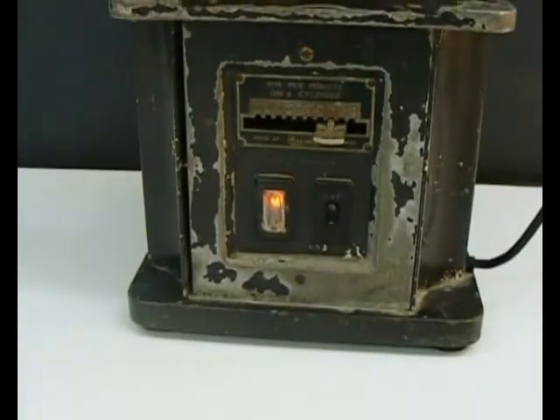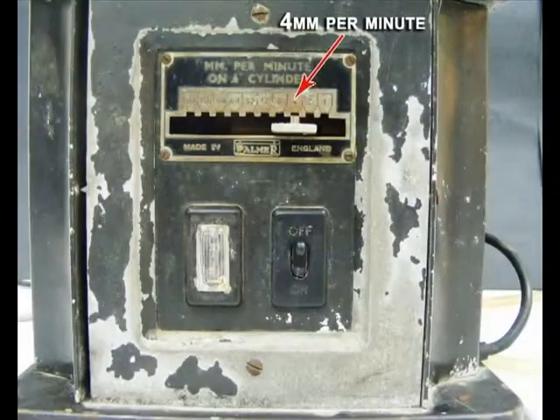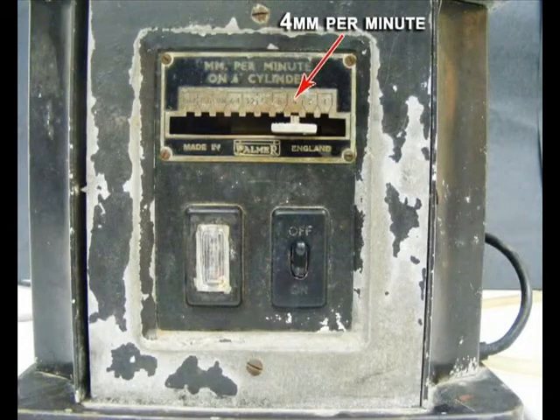In a typical experiment, the speed control switch is set to 4 mm per minute.